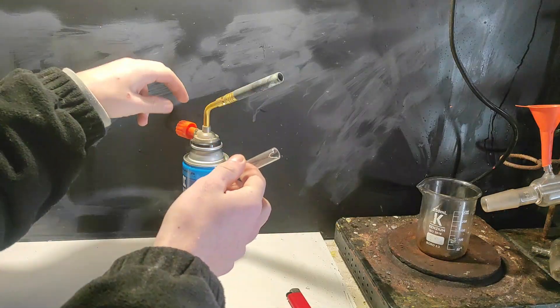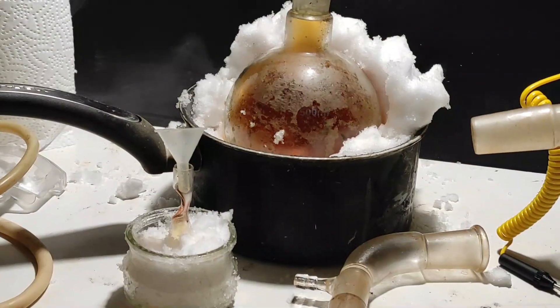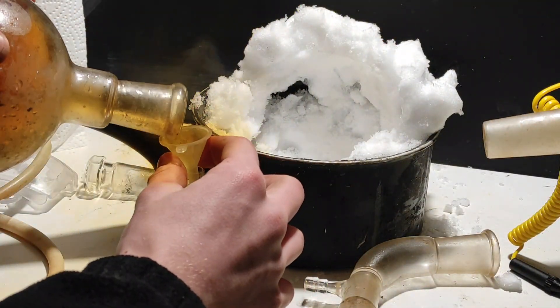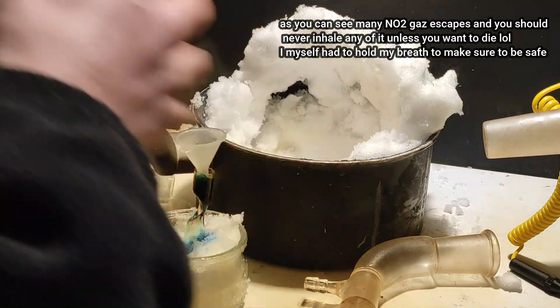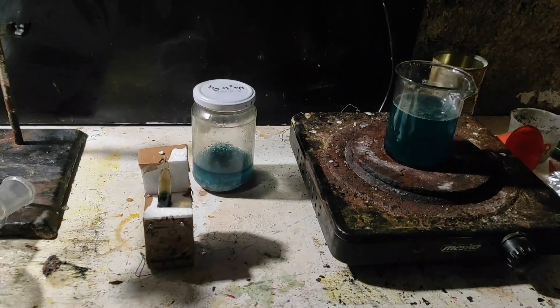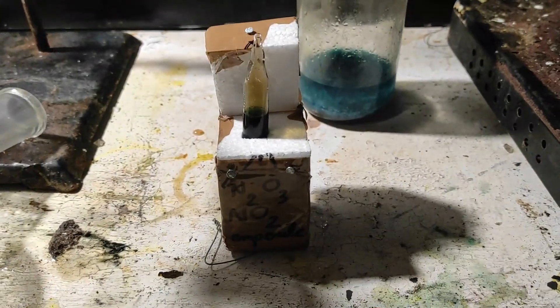I first wanted to make two ampoules, but the second one broke and I had no test tube left. So I decided I'll just put everything in one. For that I have this tiny funnel, but it's not very practical, not gonna lie. After spilling some, we take the ampoule and blowtorch at maximum power, and on the fine neck of the tube, we melt. I've lost the footage of this, but basically we just melt the test tube until it becomes completely closed. Then I made a little styrofoam box to protect it from shocks, and we're done. We're also left with some copper nitrate that I'll store for another video.